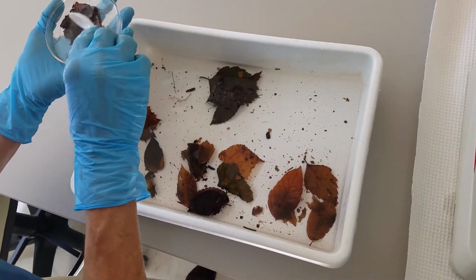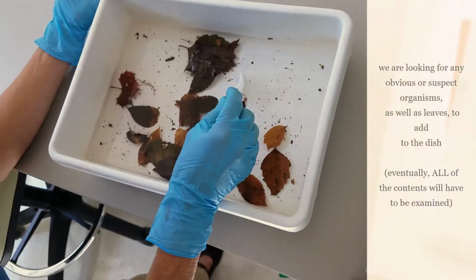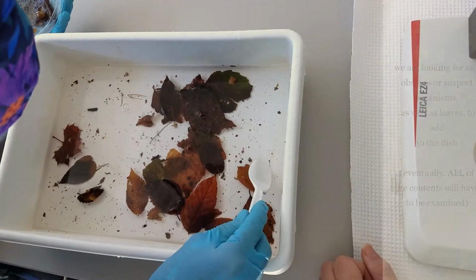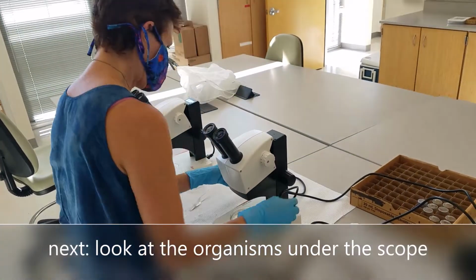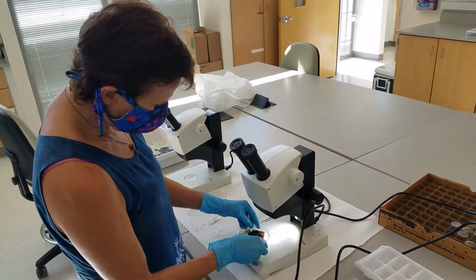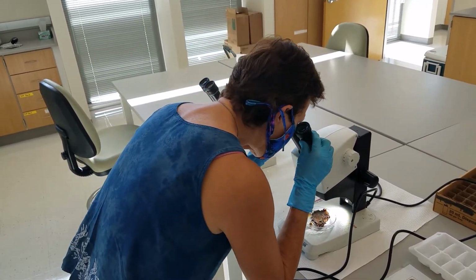The scope has a little light underneath to help you see things.